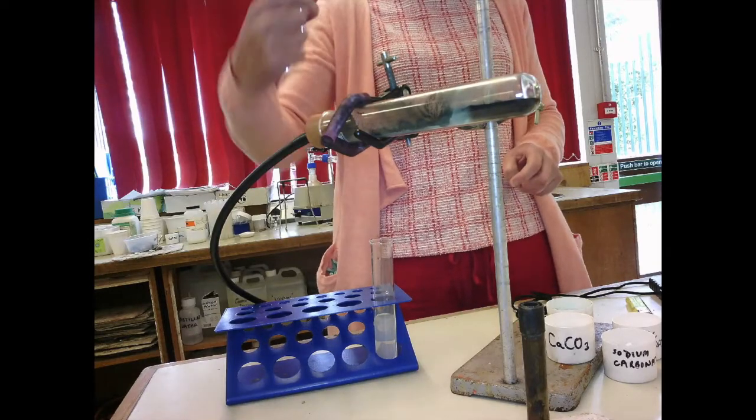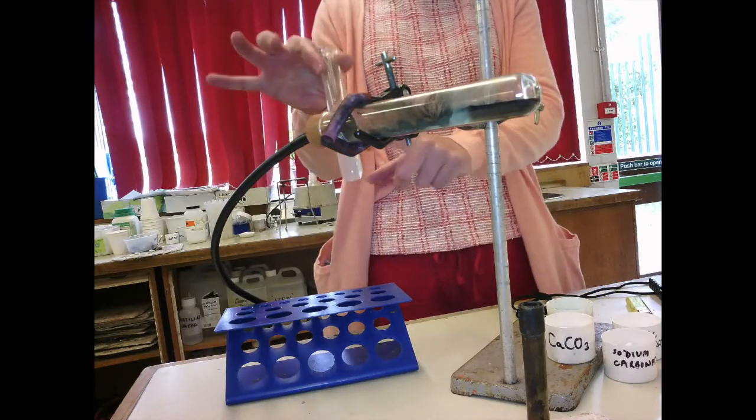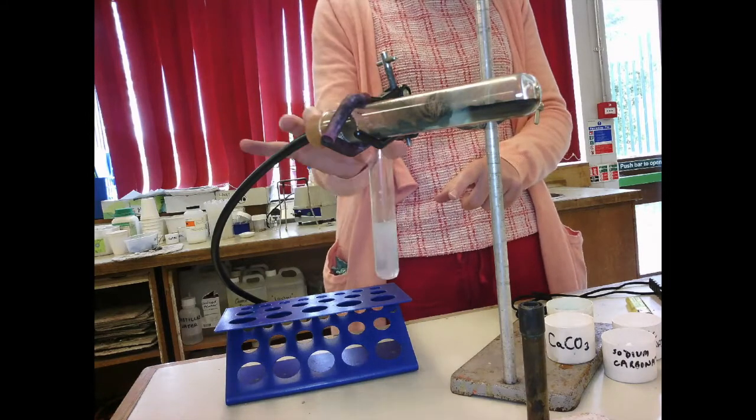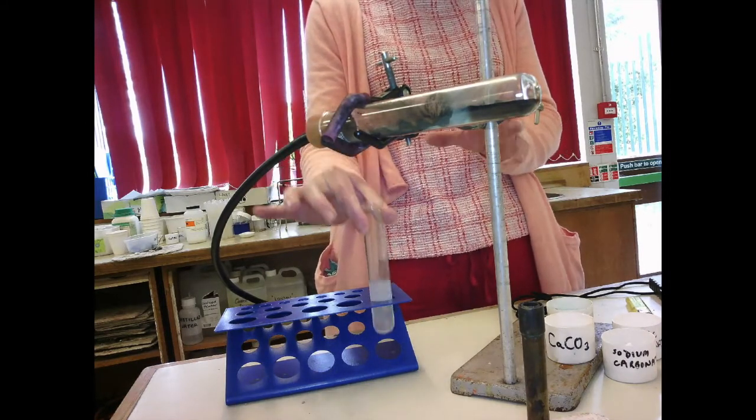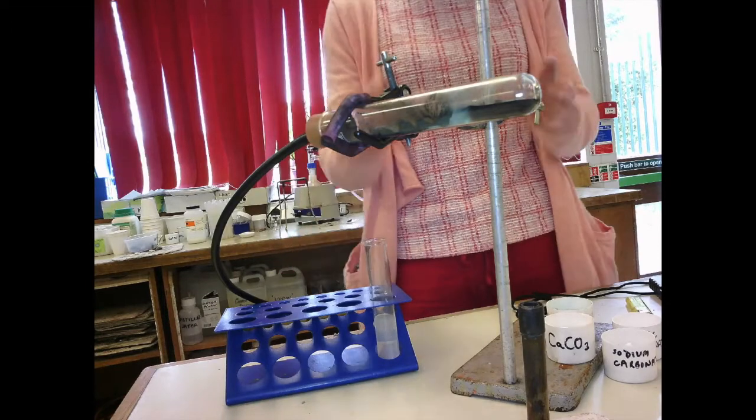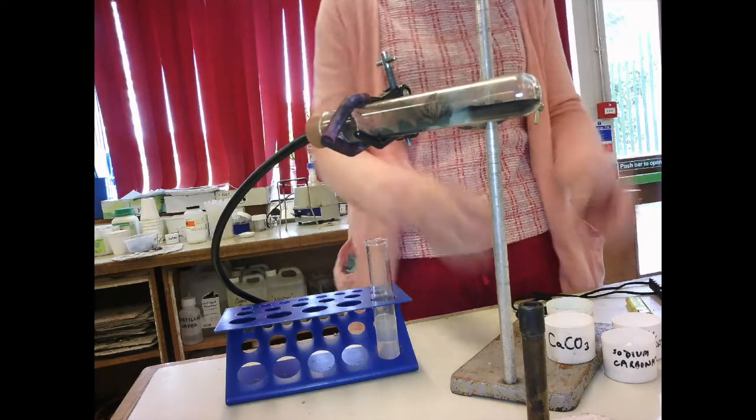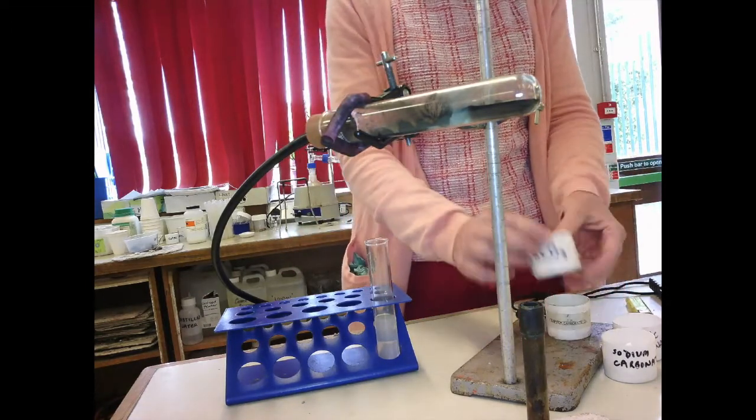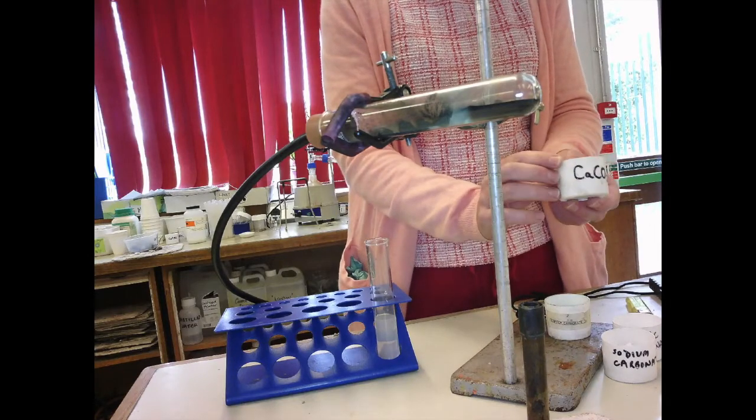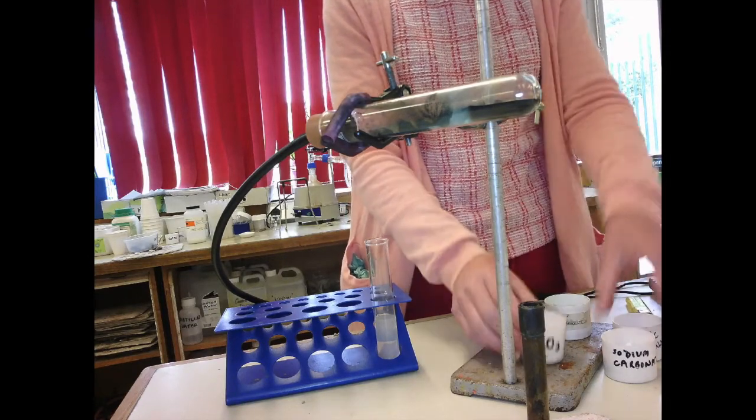So the time taken for this lime water to turn milky is recorded in your table, and you can repeat, or you would have repeated. We've just done copper carbonate. You'd repeat for calcium carbonate, you'd repeat for sodium carbonate, and you'd repeat for zinc carbonate.